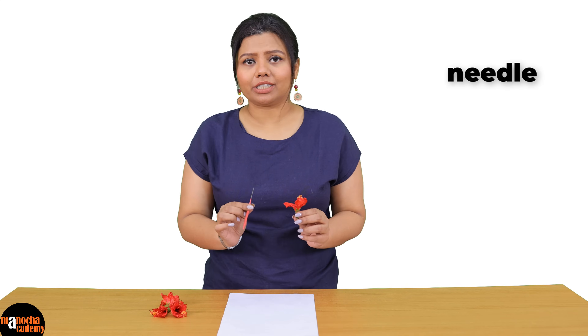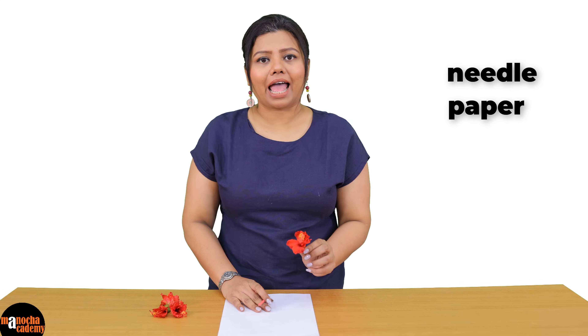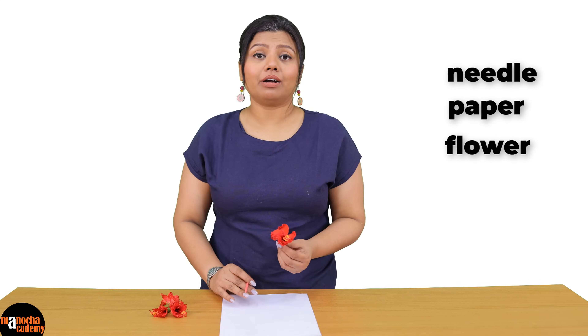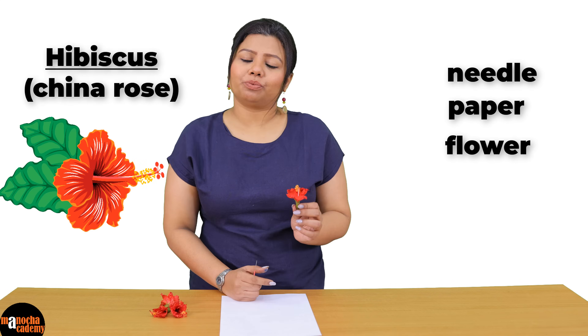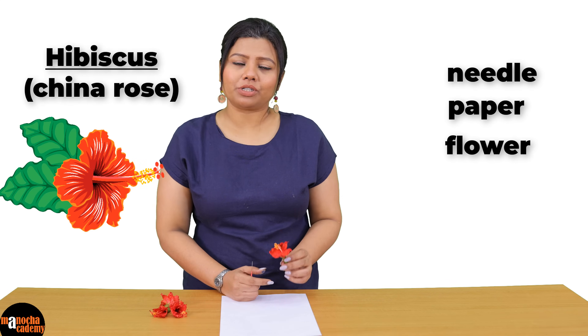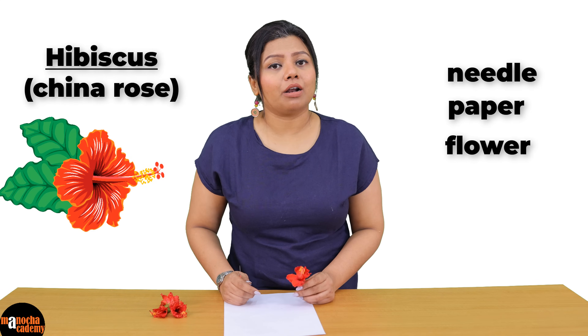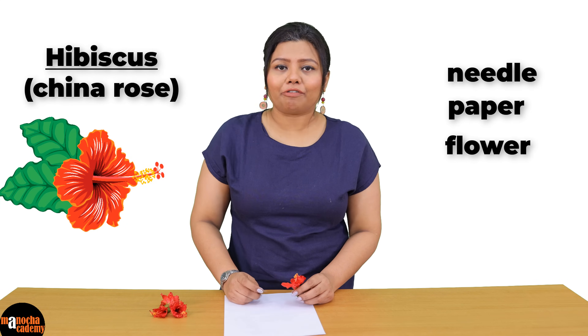For this we need just a needle, a piece of paper and the flower that you would want to dissect. Here I have taken hibiscus, which is china rose. You can take any other flower provided it is big enough for you to see the internal structures.